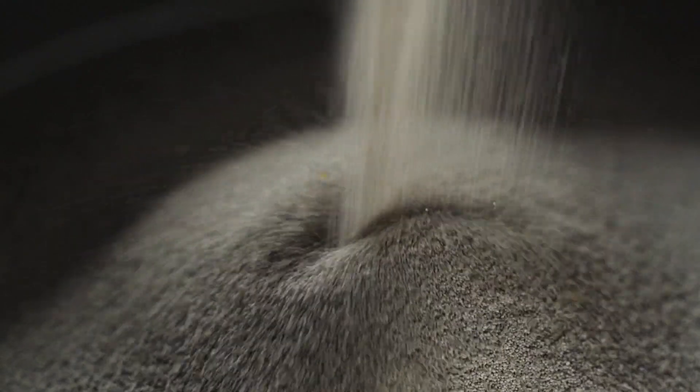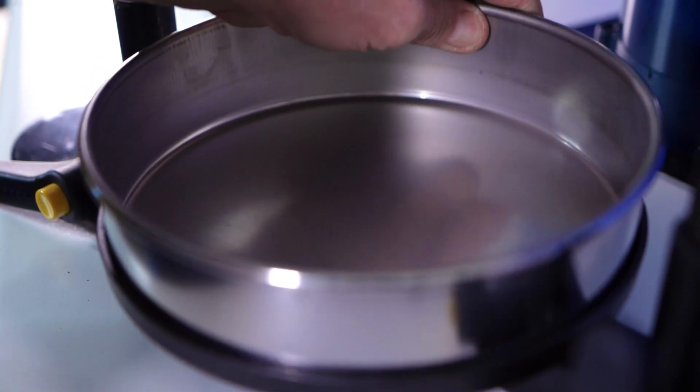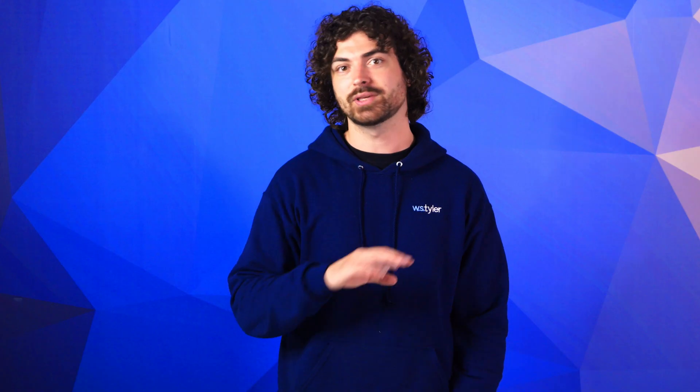Once you've divided your representative samples, the easiest way to begin the weighing process is to pick a round number that complies with the weight listed in your industry standards. Place a collection pan on a scale that reads to at least the tenth decimal point and pour your sample into it. Most operations throughout the world use grams, and it's important to account for the weight of the collection pan — otherwise you'll get a very false sample weight.